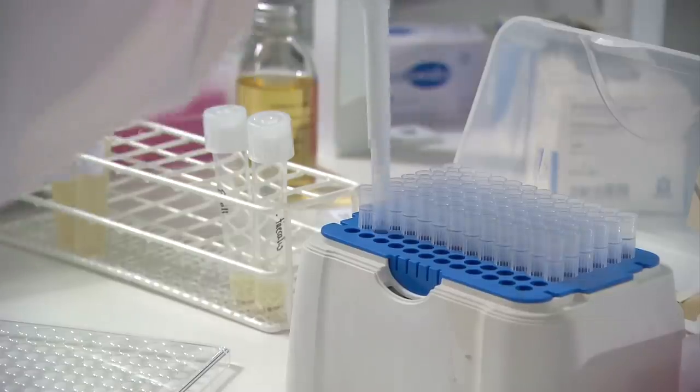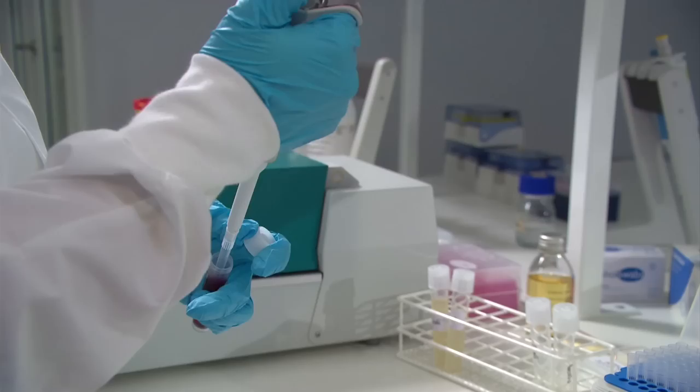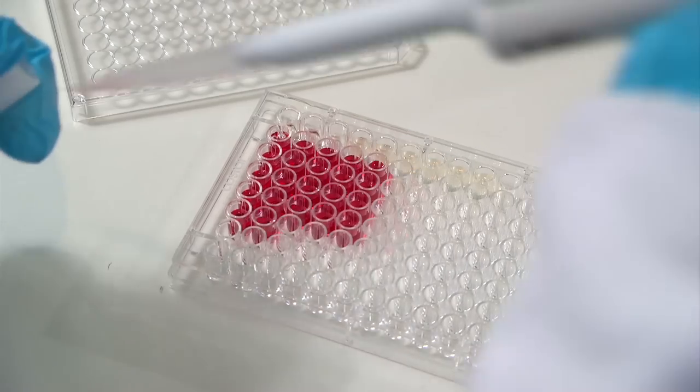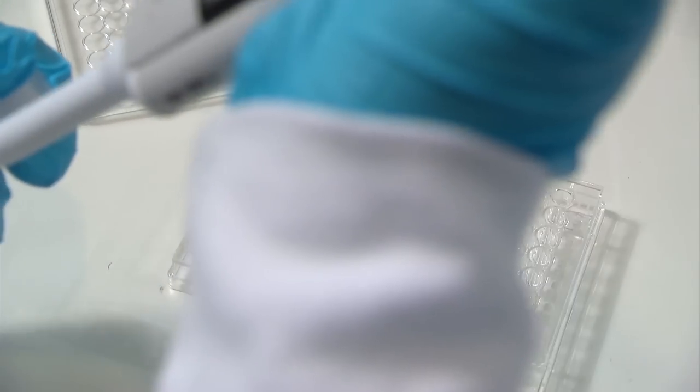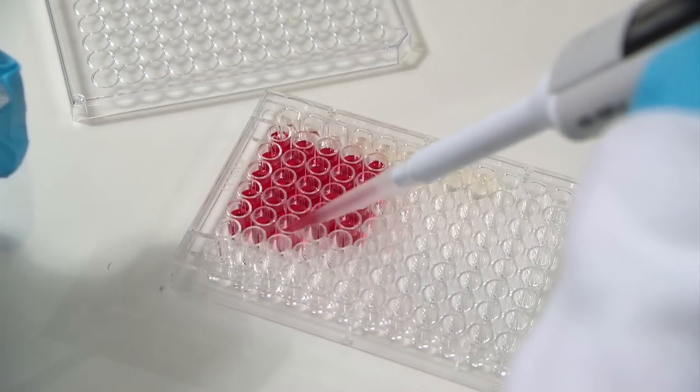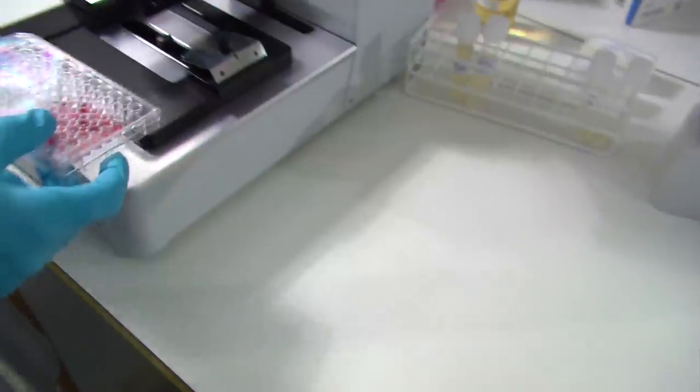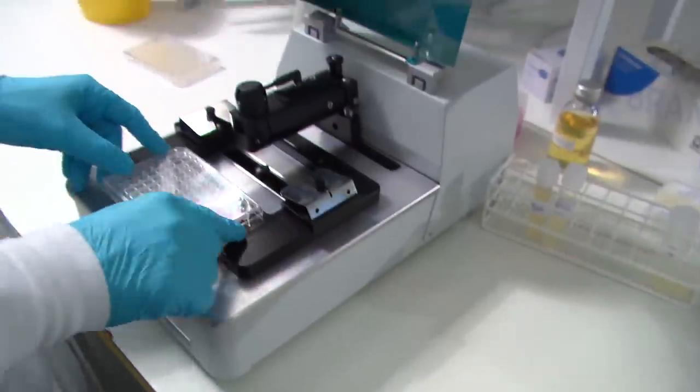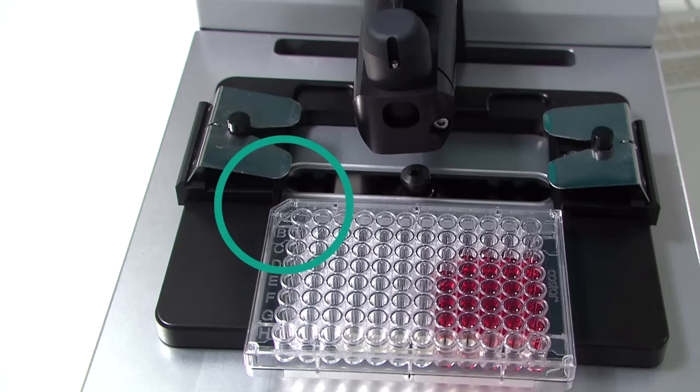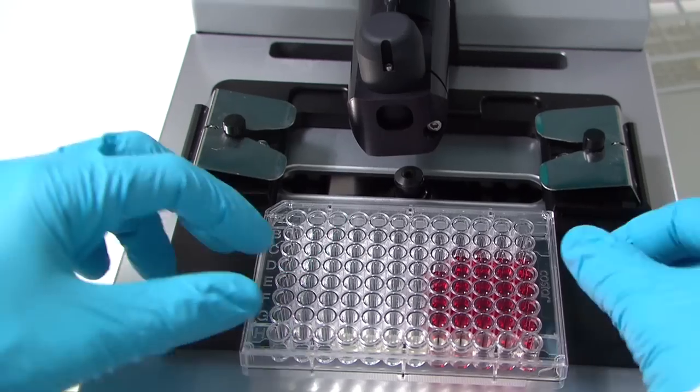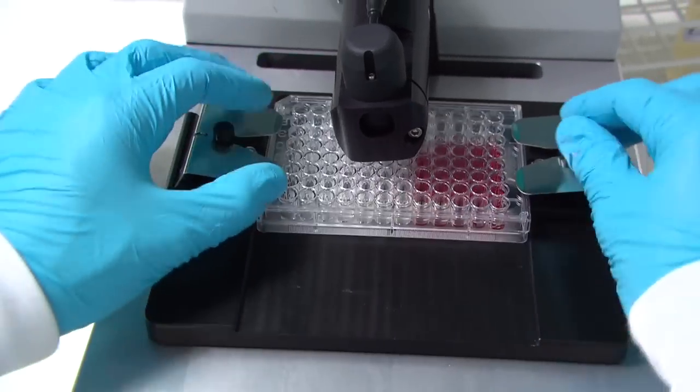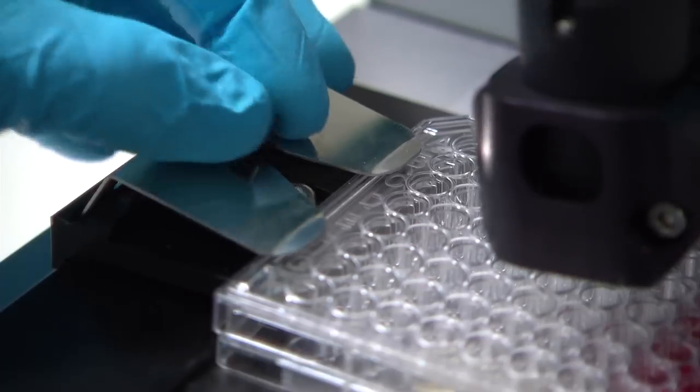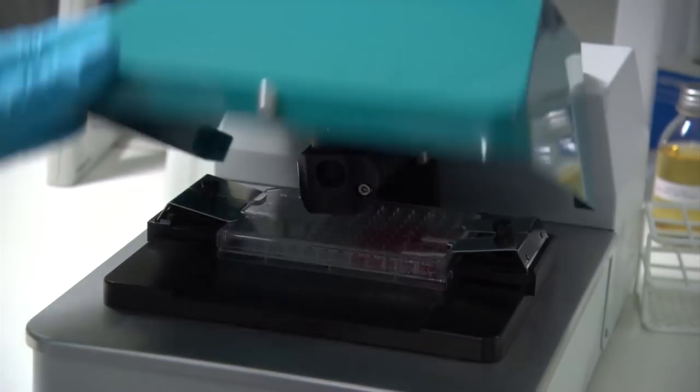The sample that has to be analyzed is pipetted into the microtiter plate. The microtiter plate is then inserted into Ocelloscope with well A1 at the upper left position. The plate is carefully pushed into place and is then fastened.